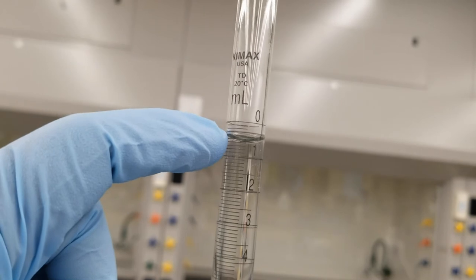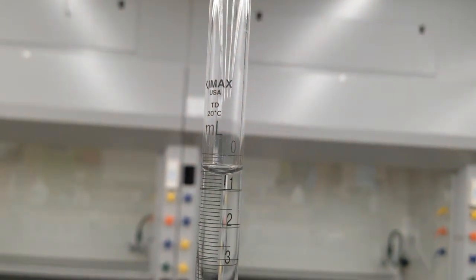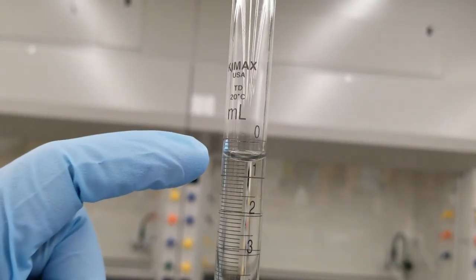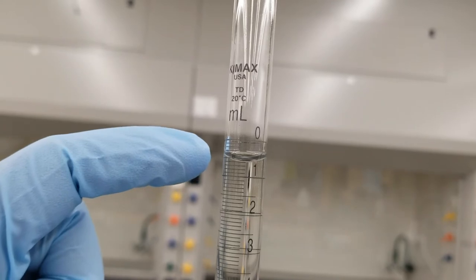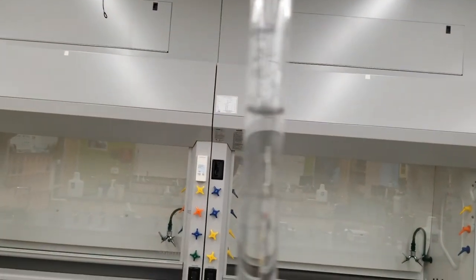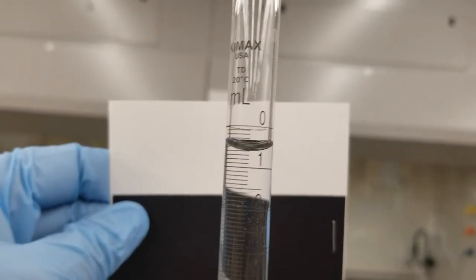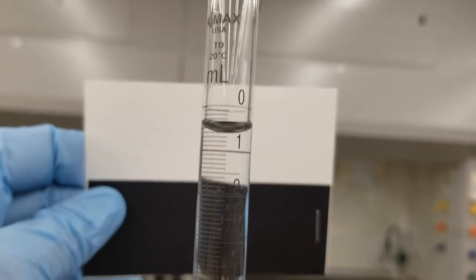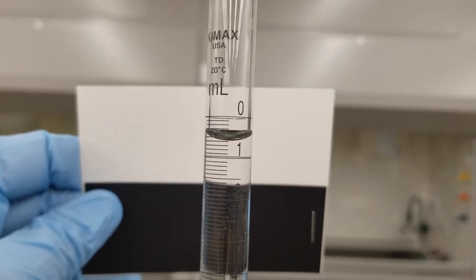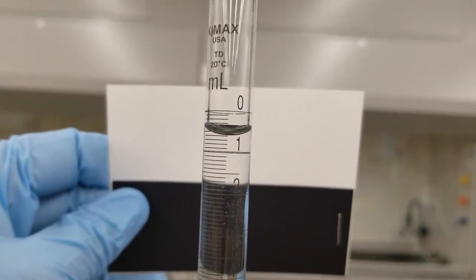Going down the tube, reading the lower meniscus — the bottom point of that curve — I've got 0.6 milliliters. If you're having trouble seeing that, I can add a white card here, which actually makes it a little bit easier to read. Hopefully you should now be able to see that reading more clearly.